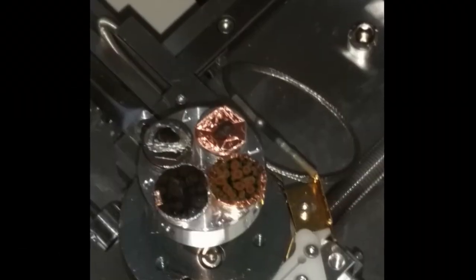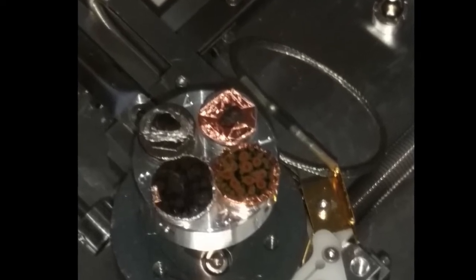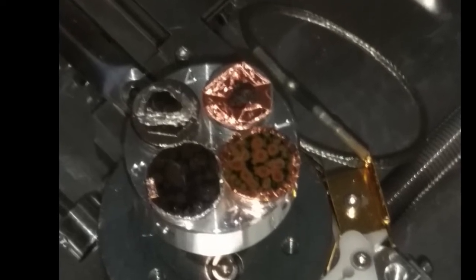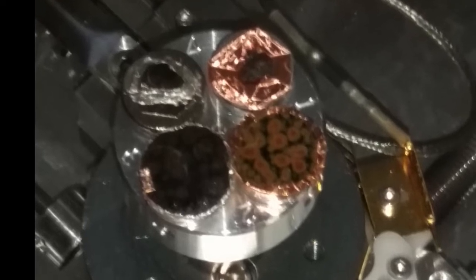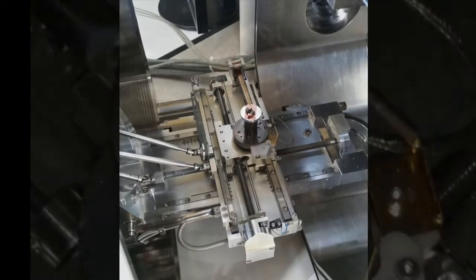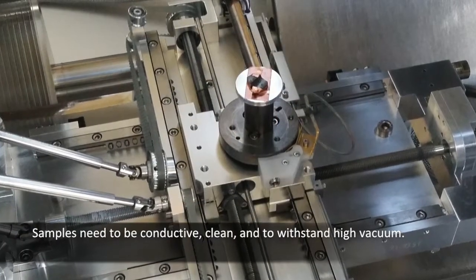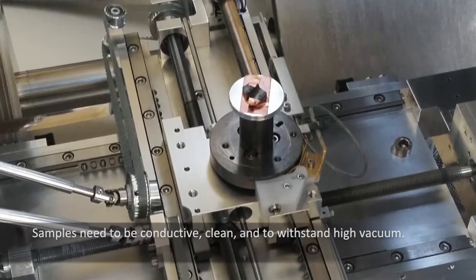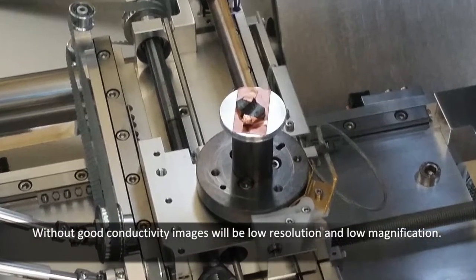These are four of my ceramic glazes that I prepared for this machine. You might notice that they're all wrapped up in foil, right? That's because using the electron microscope, you have to operate on a set of rules. The rule is that the object you're looking at has to be conductive. If it's not grounded, then the electrons that you're shooting at the sample will bounce off, and the detectors just won't get the right kinds of information.